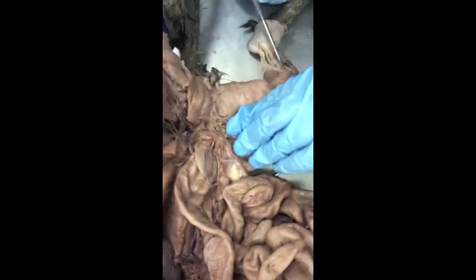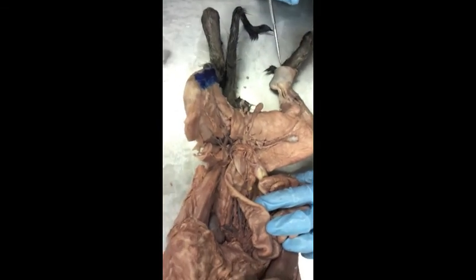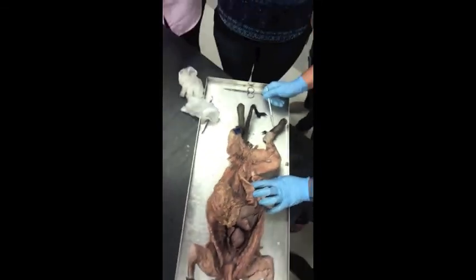Is that all we have? Oh, I should have had someone with a female cat leave their female cat out. Oh, well. I just missed the one part. What'd you miss? The entire intestines. The intestine. Okay. You have that, right? You got that.